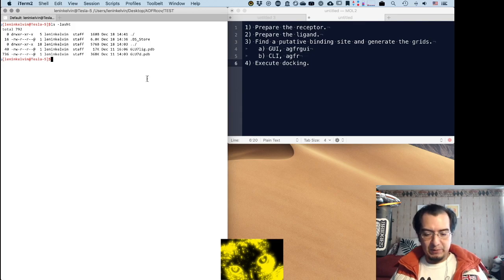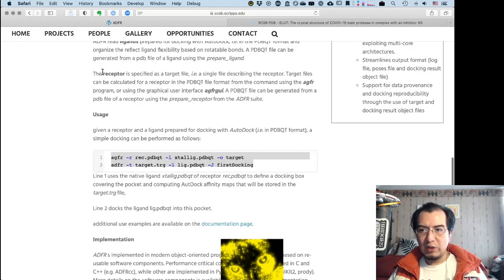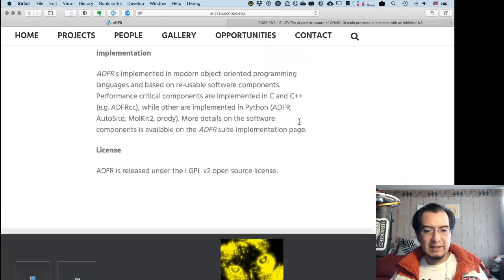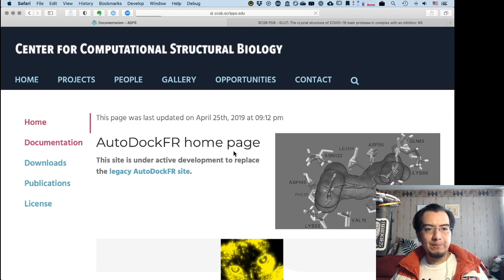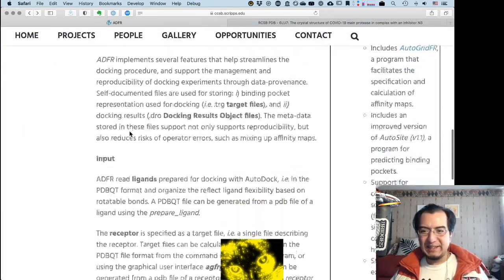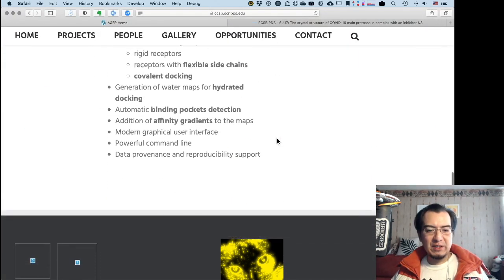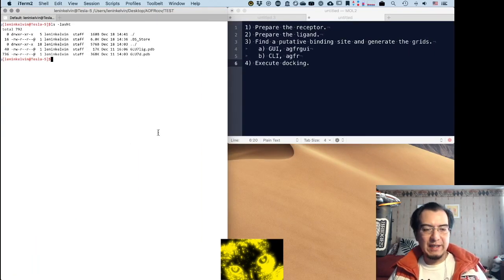So, preparing the receptor. I think that, in fact, I'm going to show you how to do it, taking it from this, here we go. Here are the basic command lines. In case you cannot see that, I'm going to make it as big as I can on my screen. AGFR for preparing the receptor, and ADFR. Now, oh, sorry, this is to actually run the process of the grids or the docking. So what I'm looking for is not exactly here. So I'm going to go to the documentation, step-by-step tutorials. And okay, this is something that is skipped here, but it's actually somewhere on the website. Let me see if it's over here. So this is part of the documentation that is kind of confusing. Okay, it's not here. I know it's here. Yeah, it's probably in the old site. So let's do it by ear.